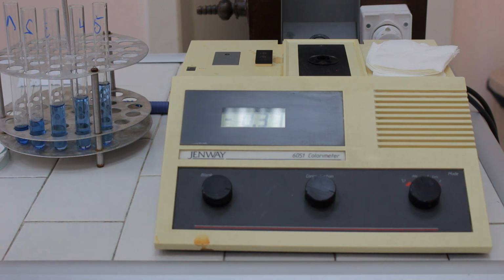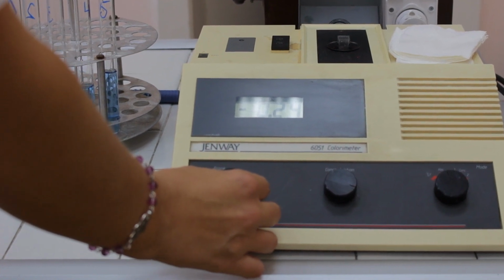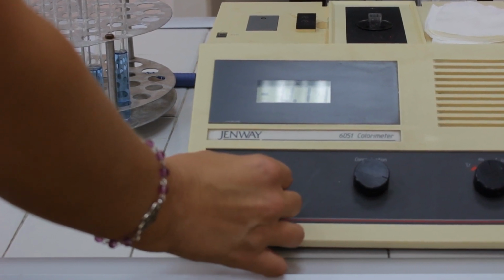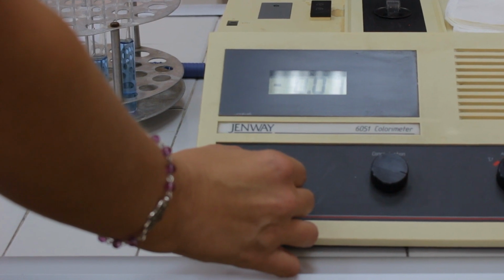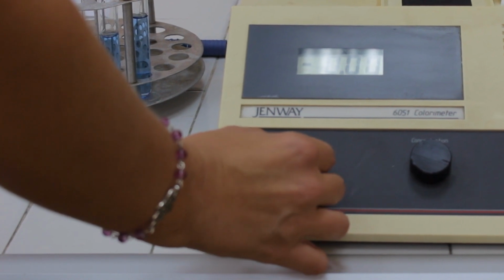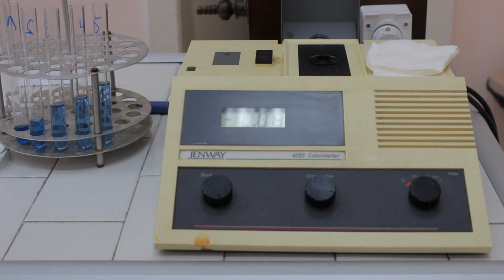The cuvette is placed in its compartment so that the light passes through the transparent parts of the cuvette. By slowly and gently rotating the wheel, marked as blank, we have to adjust the instrument to zero till we reach the 0 point on the display. The next step, take the cuvette with the blank solution and switch it with the solution whose absorbance is to be measured.